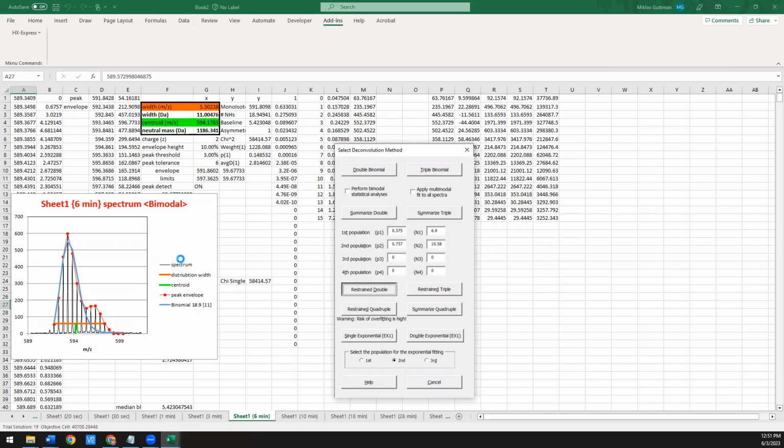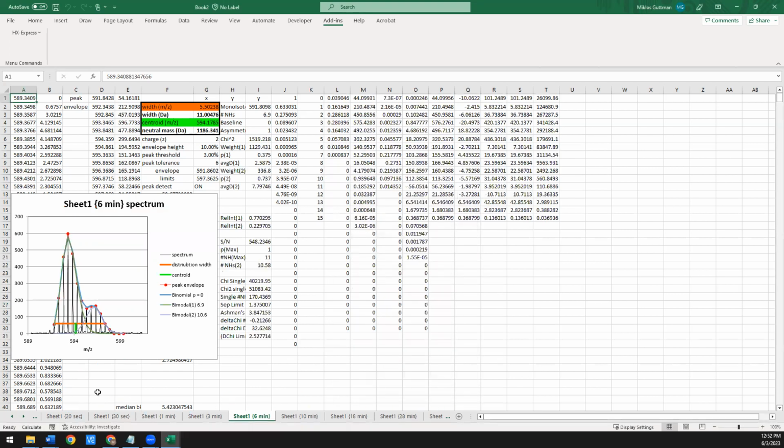And what's actually really helpful is if you have a full data set where you know that these are the two populations that you want to fit to, there's this option that you can check, apply multimodal fit to all spectra. If you have this checked and you say restrain double, it'll basically use this and fit all of your time points except for the undeuterated or fully deuterated. That way you don't have to sit here and keep clicking and doing this one after the other.